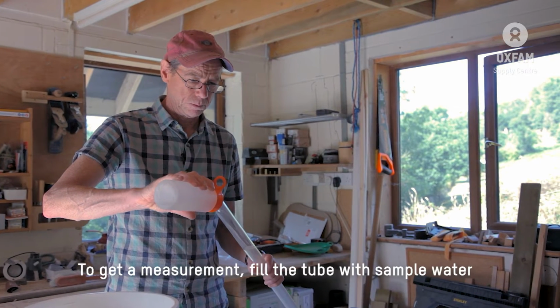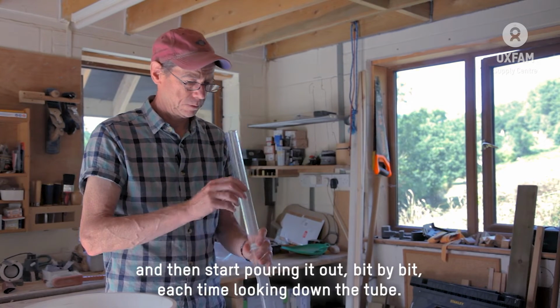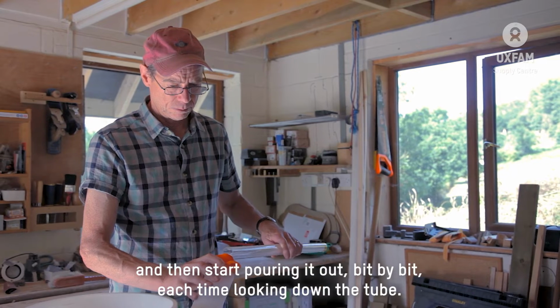To get a measurement, you fill the tube with your sample water and then start pouring it out bit by bit, each time looking down the tube.